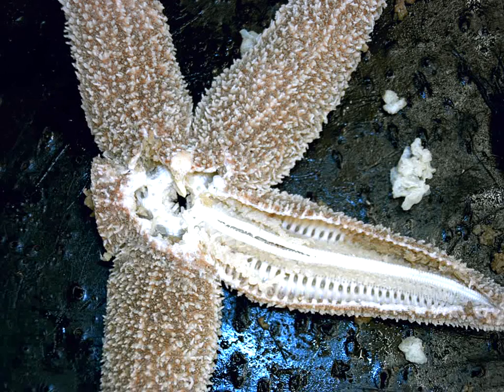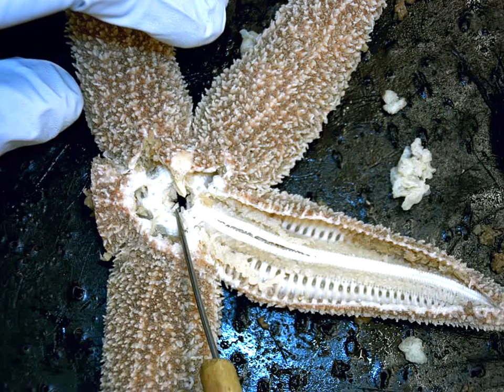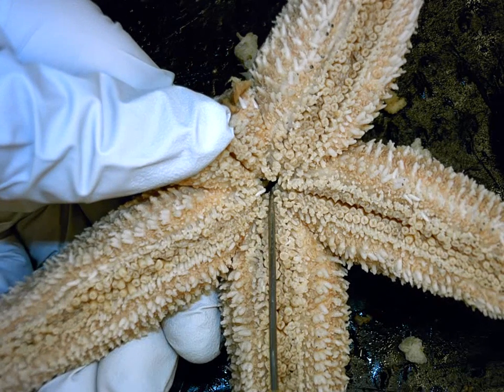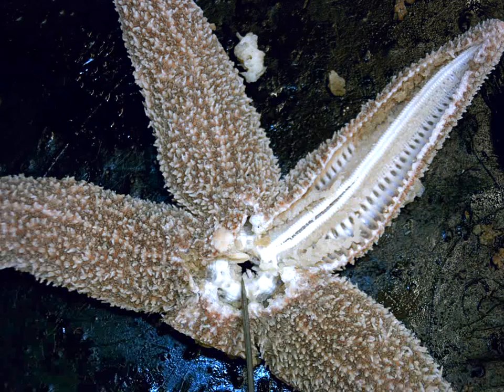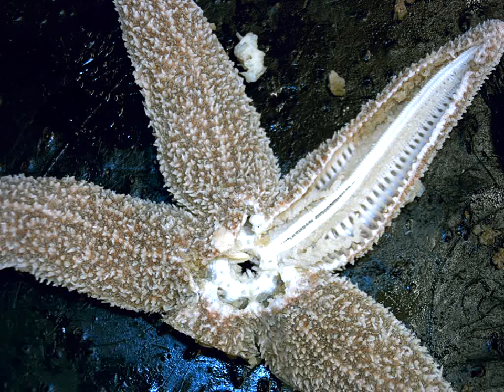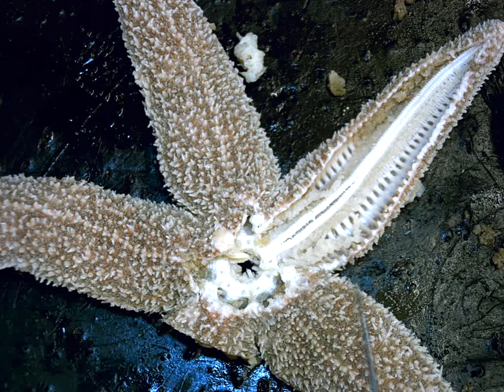We're now going to look at the water vascular system inside a sea star. We'll start with the mouth, which is dead center in the middle of the animal on the oral side — the bottom side of the sea star. This one unfortunately has some broken teeth, so to answer the teeth question in your lab, you'll want to refer to a picture on the Moodle page.